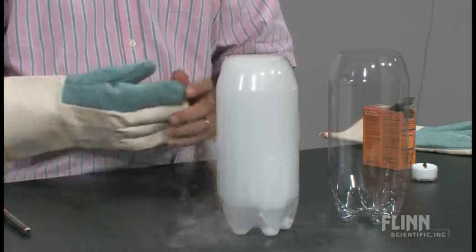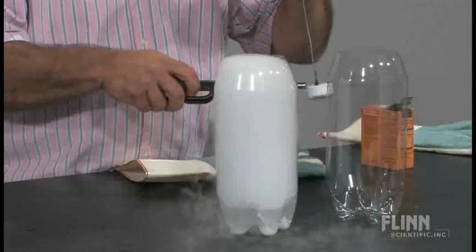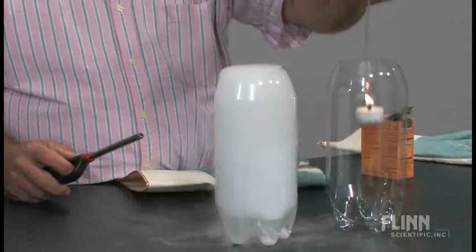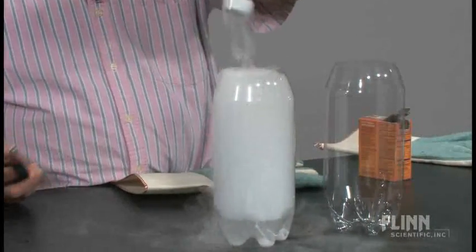And there was spilling over like that. Then you saw me put the thing in here. Still burned. And you saw it go out here. Of course.